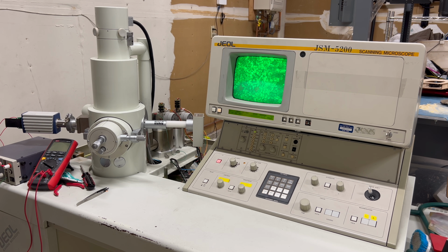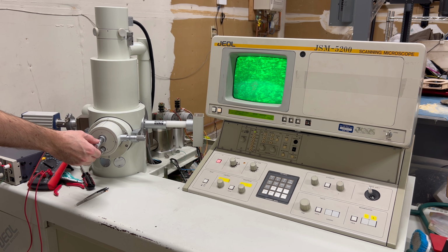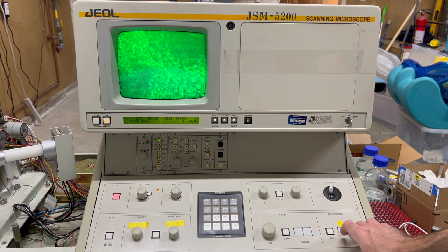Hey everybody! Check out the newest addition to my lab. This is a scanning electron microscope. When this machine was new, it would have cost over $100,000. This particular machine was broken, so I got it for free.